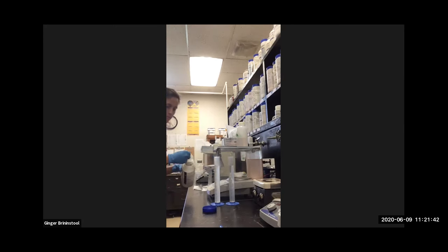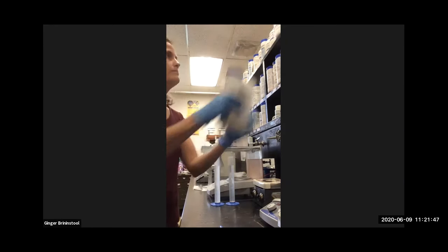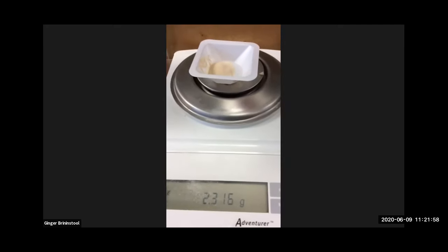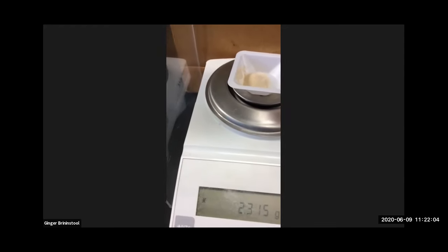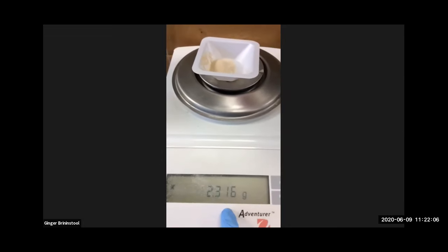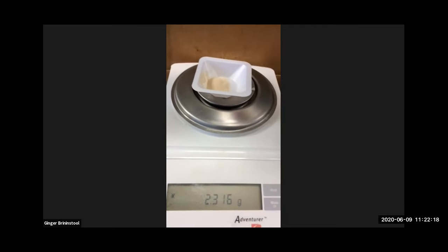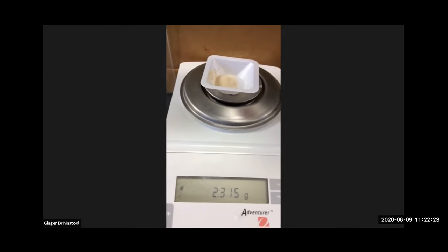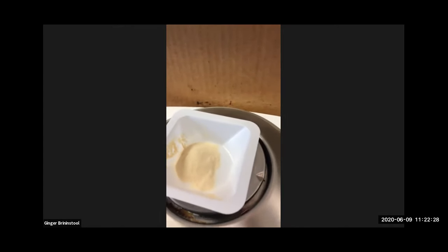All right, okay. So, done. Put the cap back on, put it back up there on the shelf. All right, so how'd I do? Pretty good. So let me tell you, the thousandths, the hundredths, we don't need to be that picky. 2.3, measuring to the tenths, that will suffice. We don't need to be as precise as hundredths or thousandths. It looks something like this, the nutrient agar powder does. You know, cake mix, right?